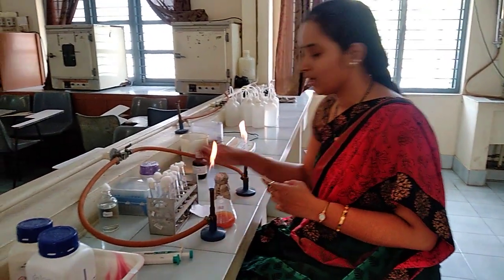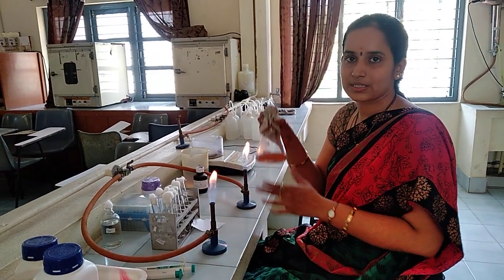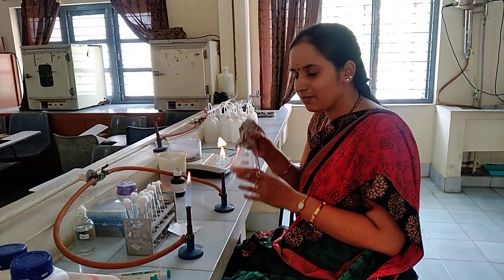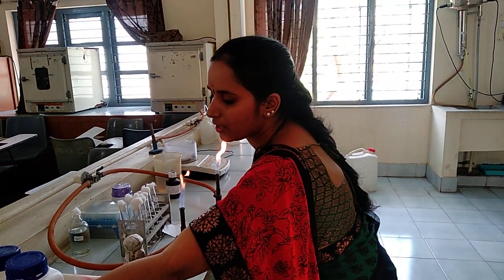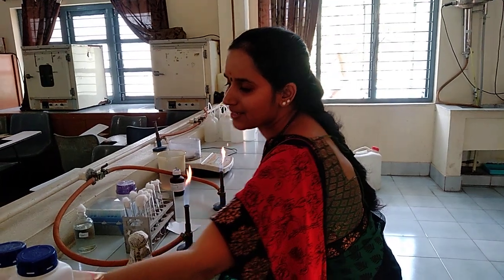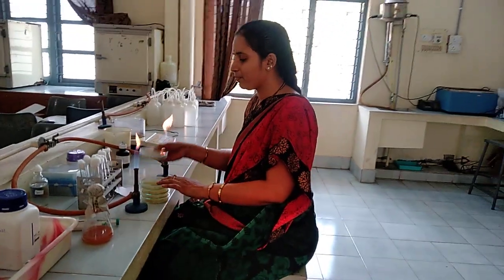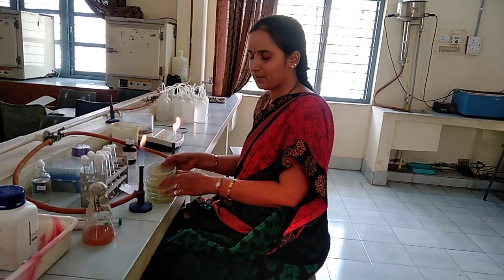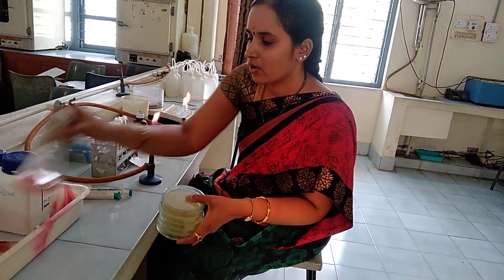Now I am ready with the sterilized PDA medium. The prepared medium has to be poured into sterile Petri plates. I have already poured the PDA medium into sterile Petri plates. Now we are ready with the medium.